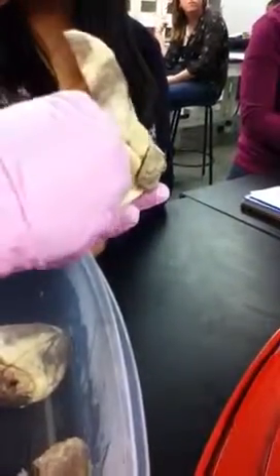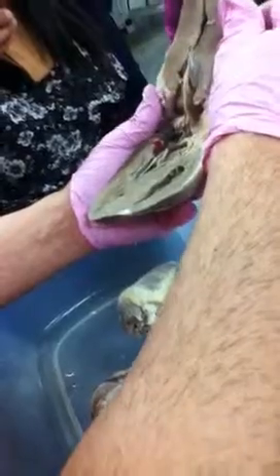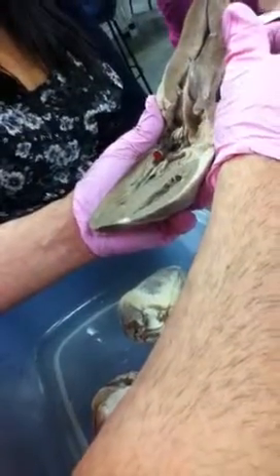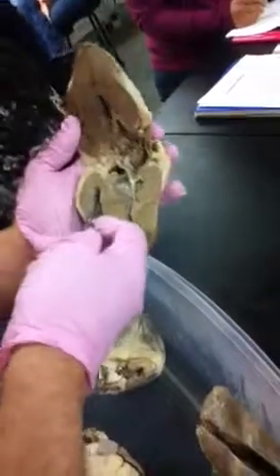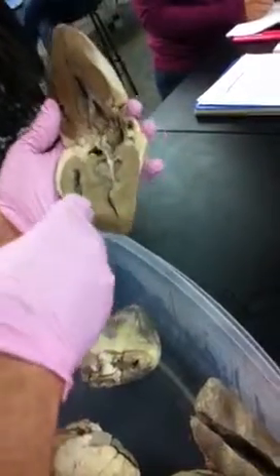So if there's a probe in here, and it asks which vessel the probe is inserted into, it's going to be the pulmonary veins, because it's the left atrium. Oxygenated blood goes into the left atrium. If it's going into the right atrium, I'd have to show you a clear right atrium, but let's just say up here. What's going into the right atrium? The vena cava.